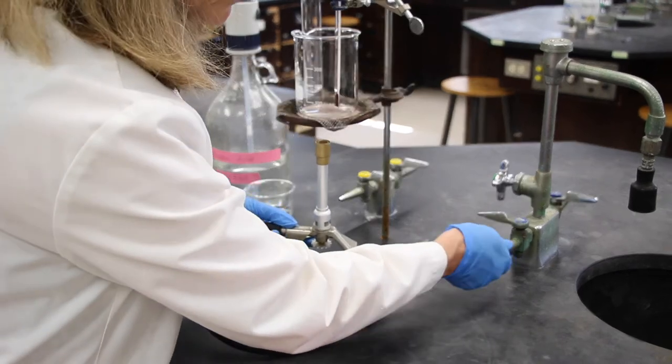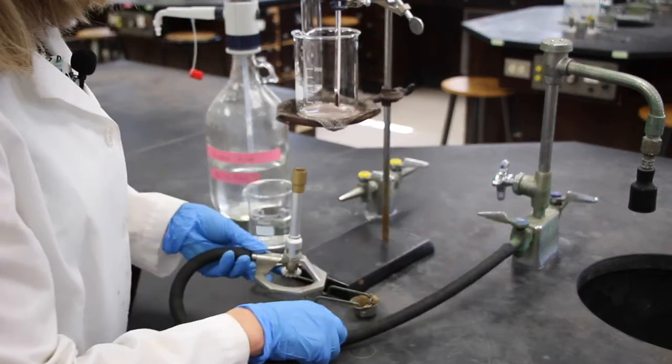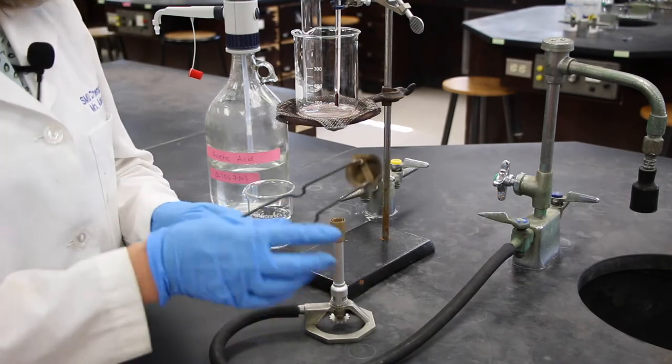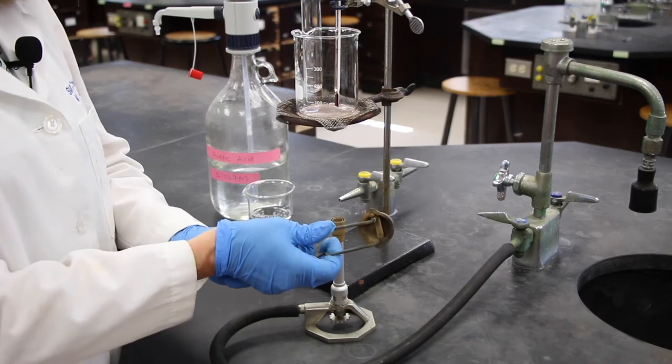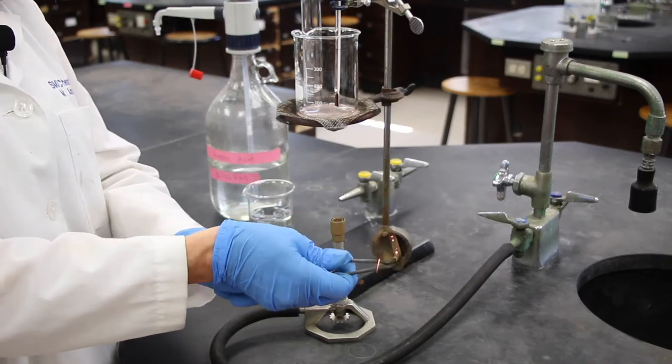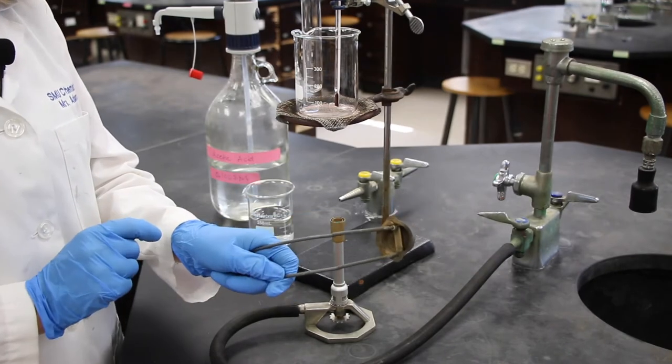We'll hook it into our gas supply line. I'm not going to turn it on yet because I want to show you the striker. There's a flint in here, and you need to be sure that you have at least a good spark.